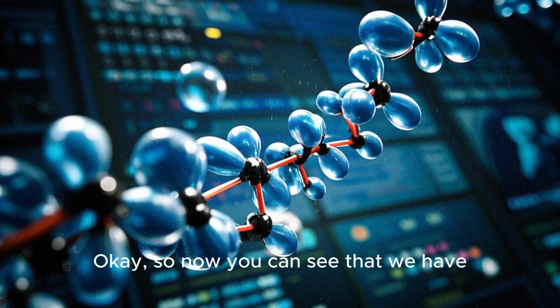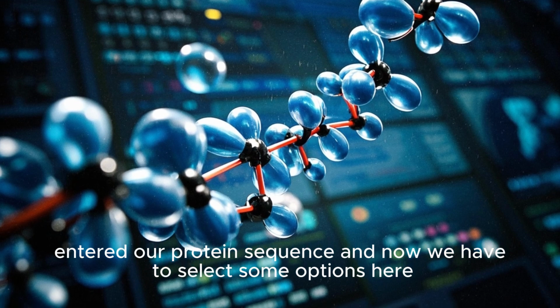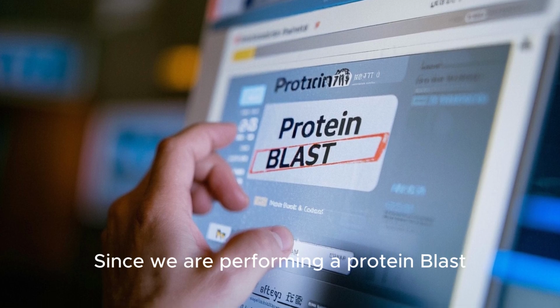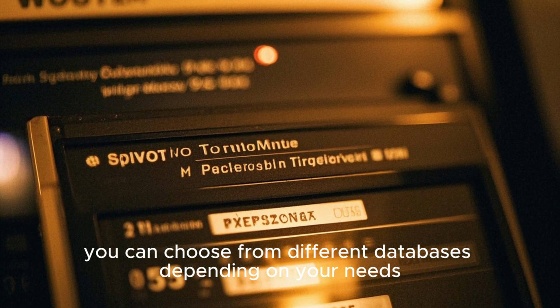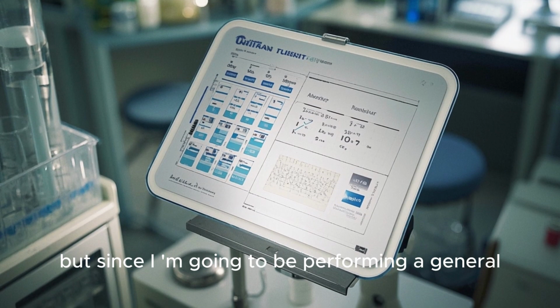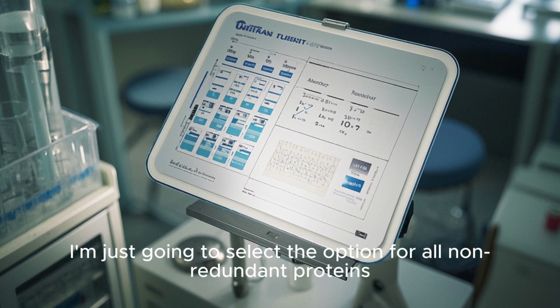Okay, so now you can see that we have entered our protein sequence, and now we have to select some options here. So the first one is the program we want to use. Since we are performing a protein BLAST, we will be selecting the option for Protein BLAST. For the database, you can choose from different databases depending on your needs, but since I'm going to be performing a general BLAST search, I'm just going to select the option for all non-redundant proteins.